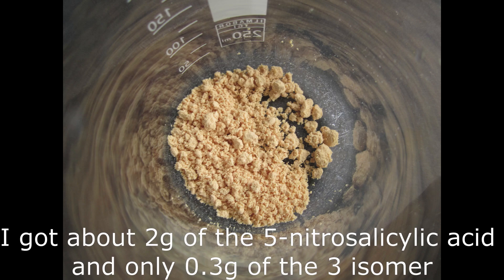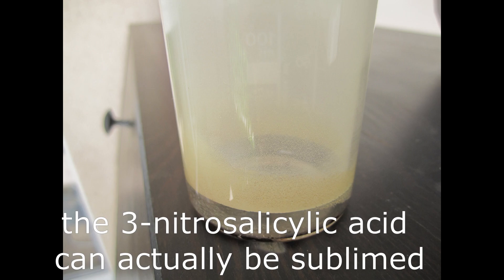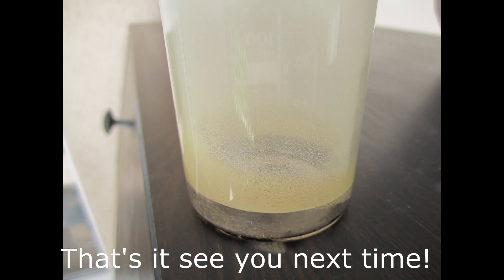Oh yeah, it's crystallizing! Yes, it is!